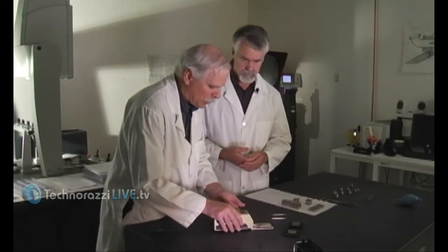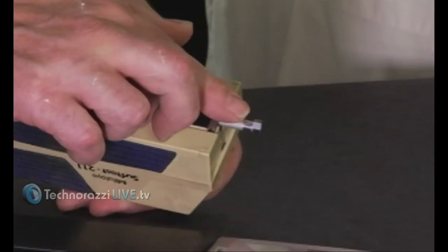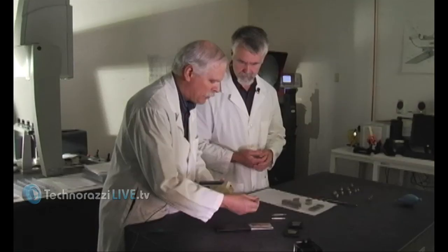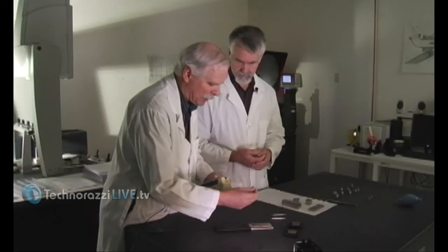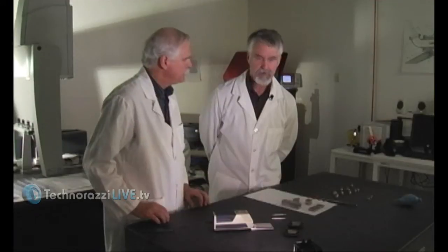What about special considerations for taking care of the equipment? The most fragile part is the working surface — the stylus. These are replaceable; the probes do come out. They used to make just replacement styluses that required getting inside and re-soldering, but now you just buy a new probe.